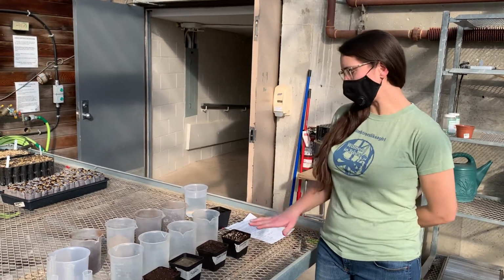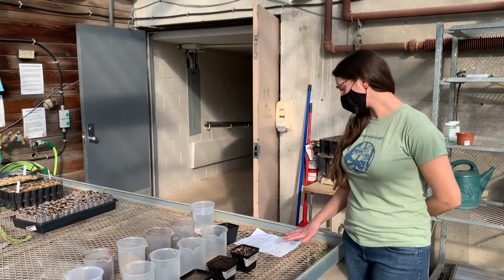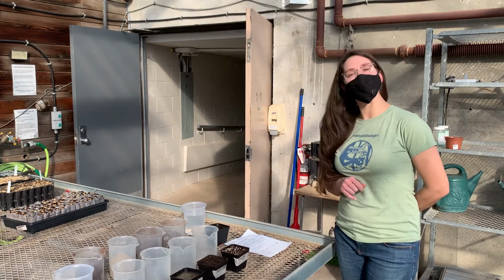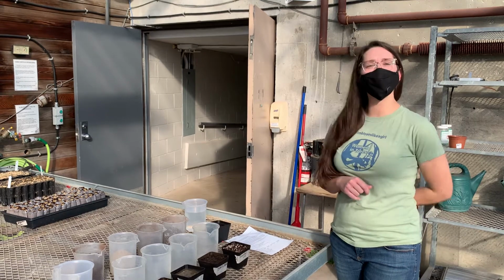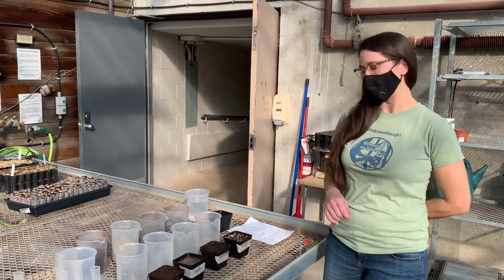Okay, so we have saturated all of our pots and we have numbers for you to fill in your chart. So the saturation volume for sand was 133 milliliters, for peat was 325 milliliters, for the peat sand mix was 203, and for the forestry mix was 250.